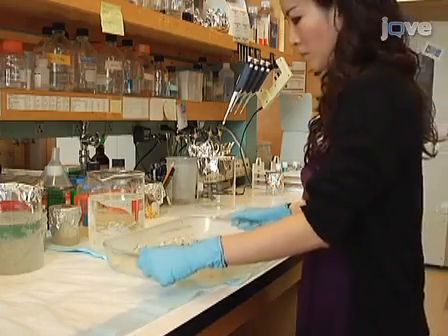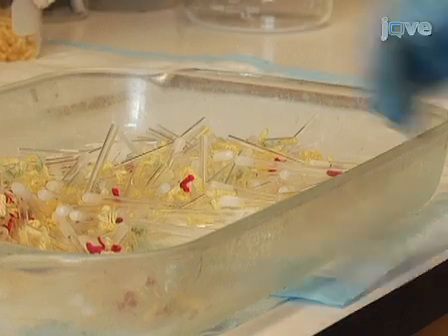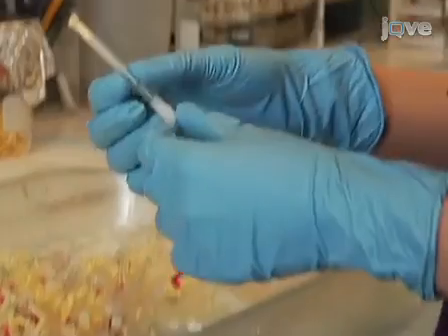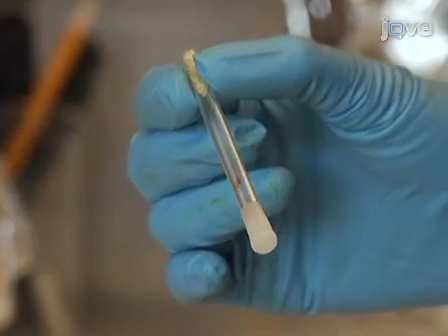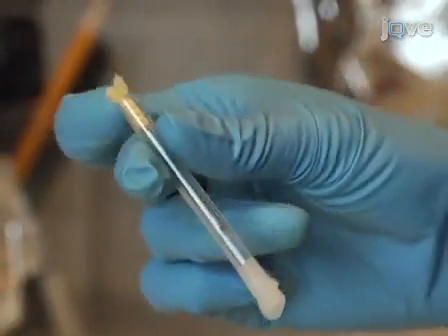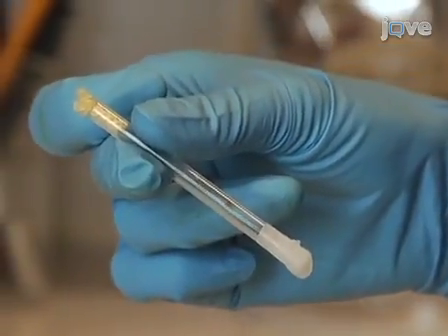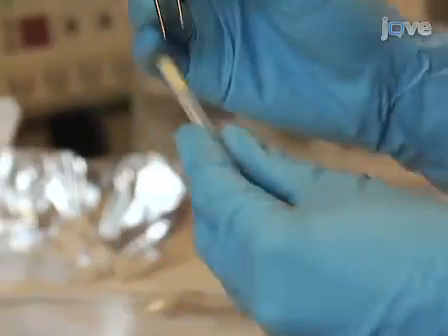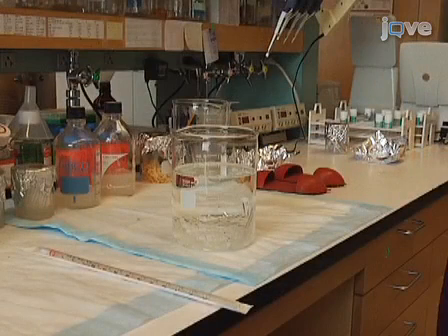Since glass activity tubes can be reused multiple times, the following preparation procedures describe using previously used and unclean activity tubes as the starting point. If you are using new activity tubes, simply skip to the autoclaving of the tubes as shown later. Remove the plugs from used activity tubes and put them into a large glass beaker. The tube should only fill up to half the beaker.